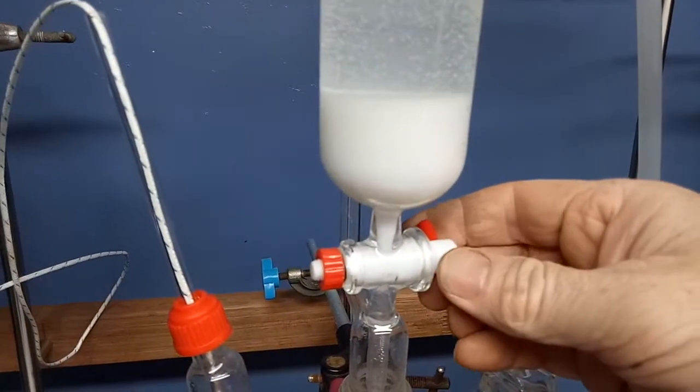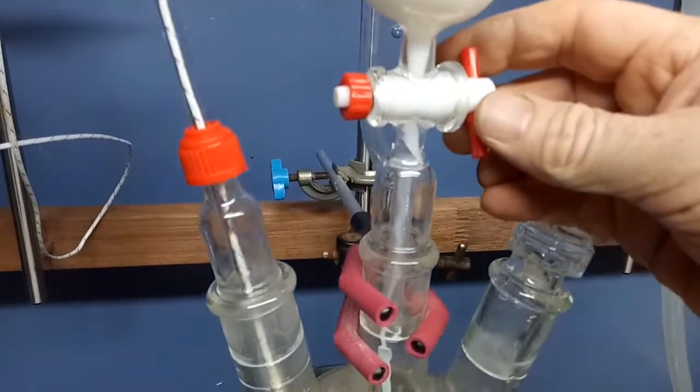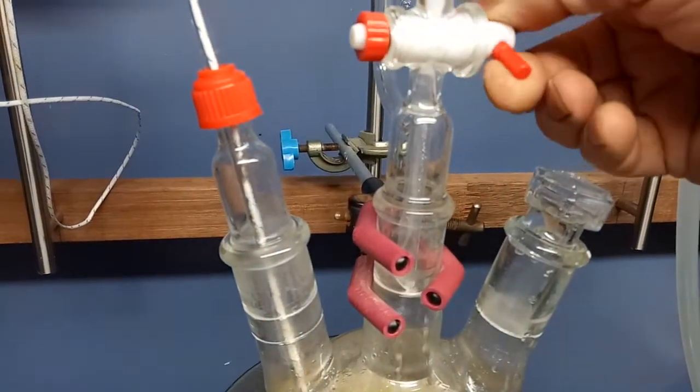Also got some floaties in there, some purple kind of stuff, which I presume comes from the catalysts that are added. Now that's not so much of a good sign, because if your catalyst is forming a separate phase, it's not going to take part in the reaction so well.